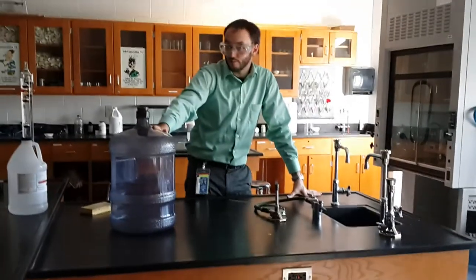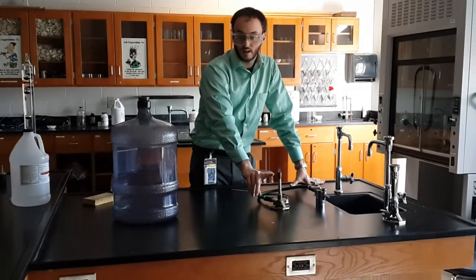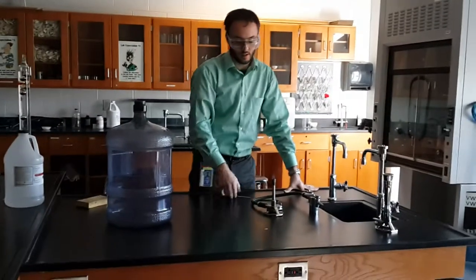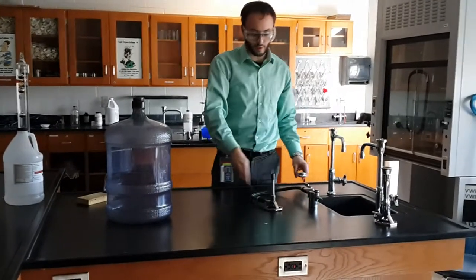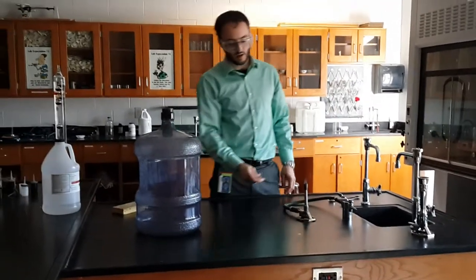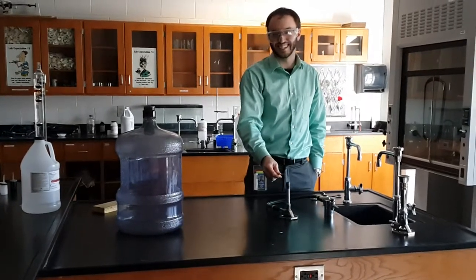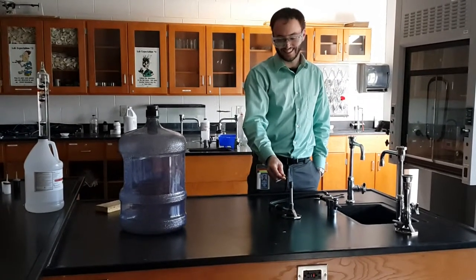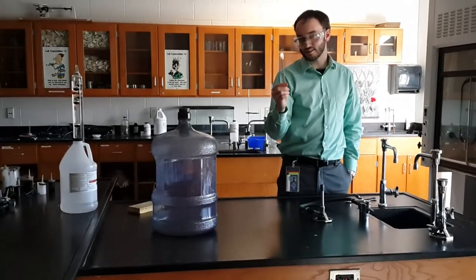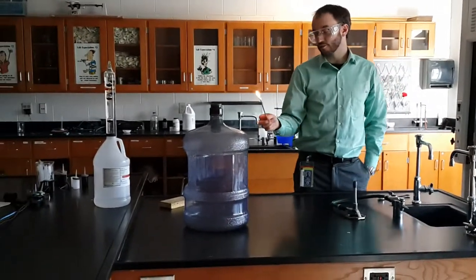So, if this is combustion, what kind of reaction is that? Combustion. I have a fuel burning, it's burning in oxygen. Alright, you ready? Yes. So what kind of reaction is this? Combustion. Sensing a pattern.